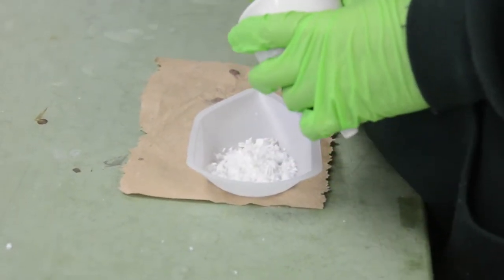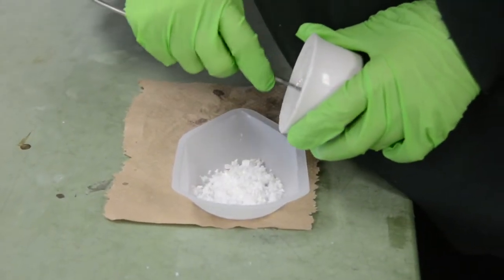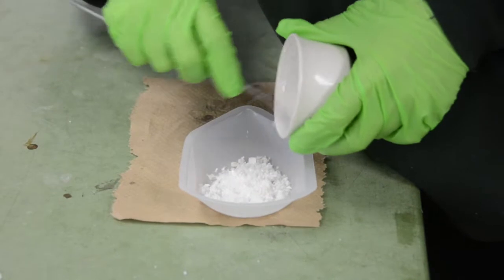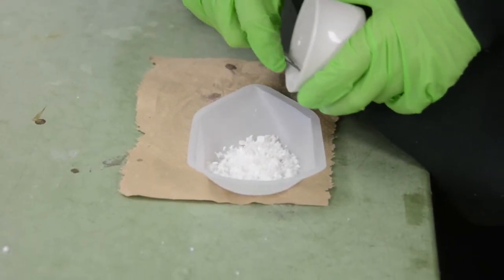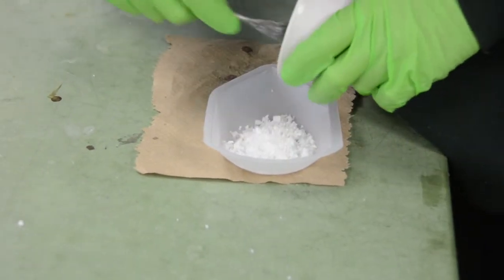So you guys are watching Shelby scrape the crystals into the weigh boat. And then you get to pick through there and get the glass beads out because we don't want to be weighing the glass beads.